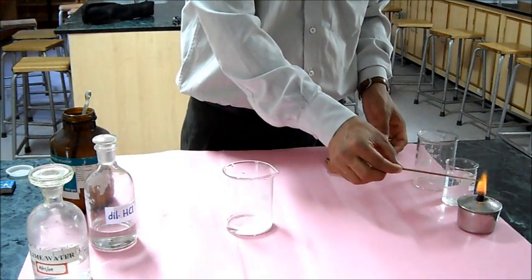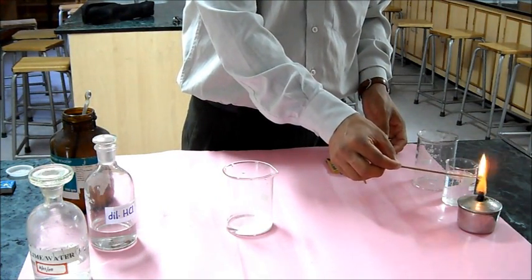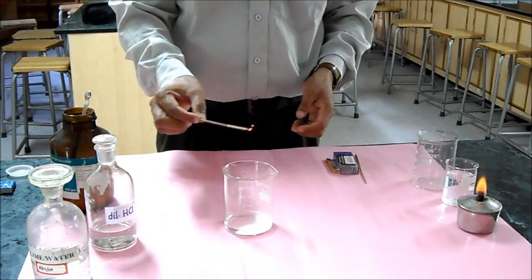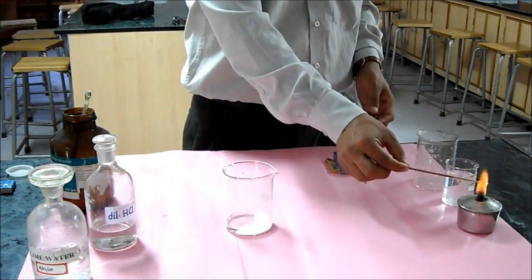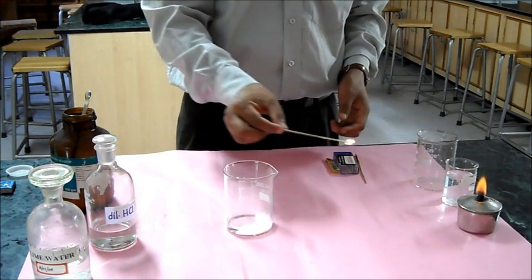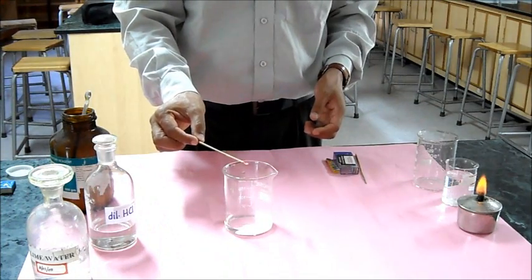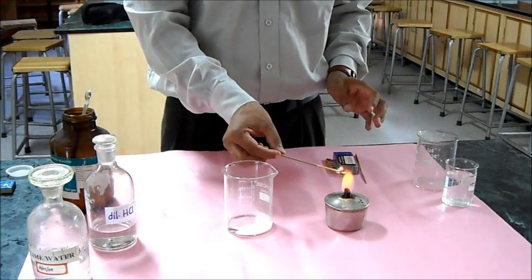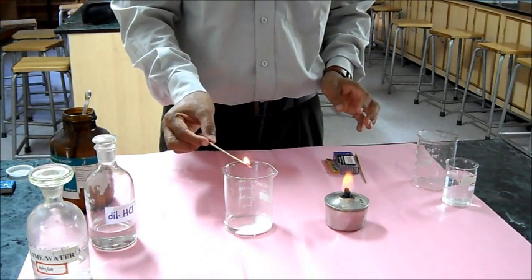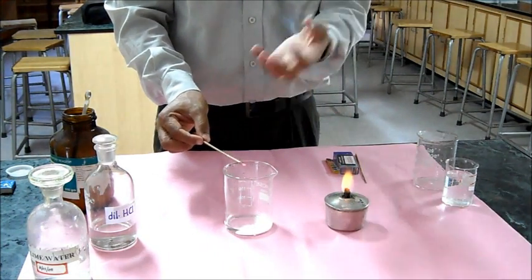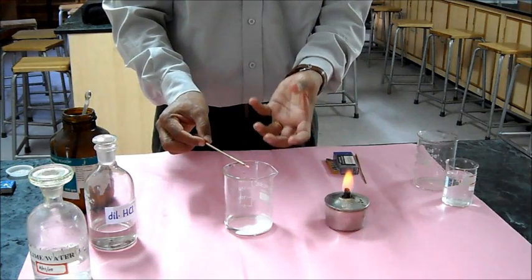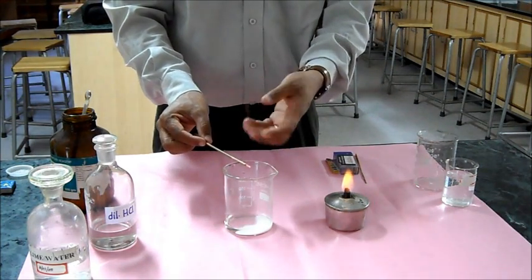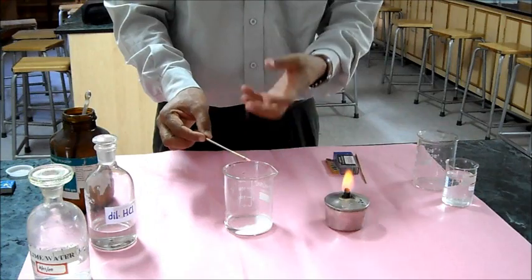I take a burning splint over it and this will show the flame test. As I pass it over, you see that it extinguishes the fire. That means the gas is extinguishing the fire since it is a non-supporter of combustion.